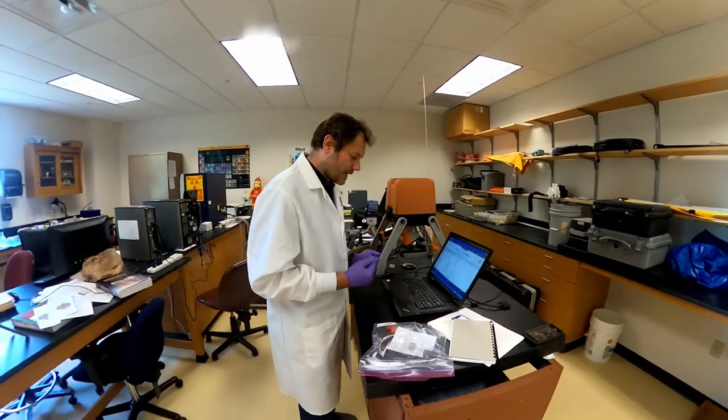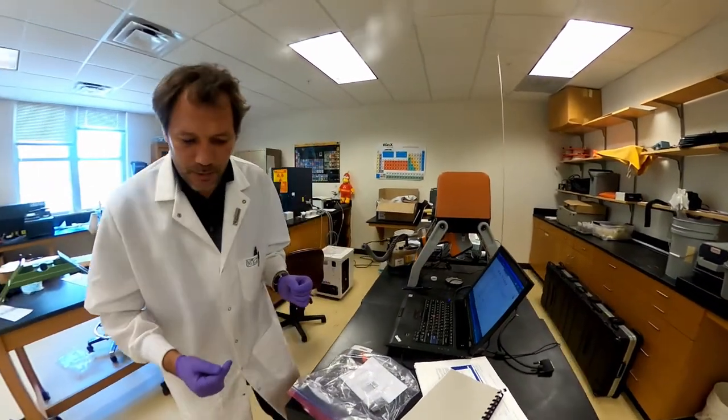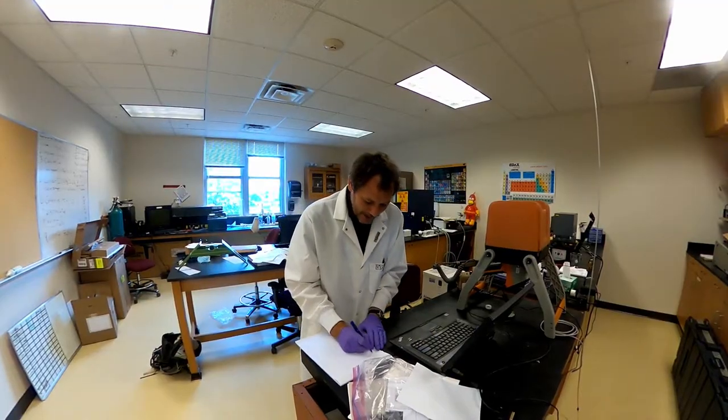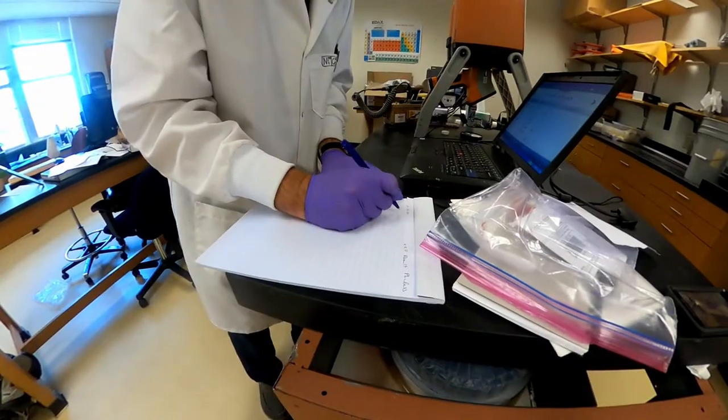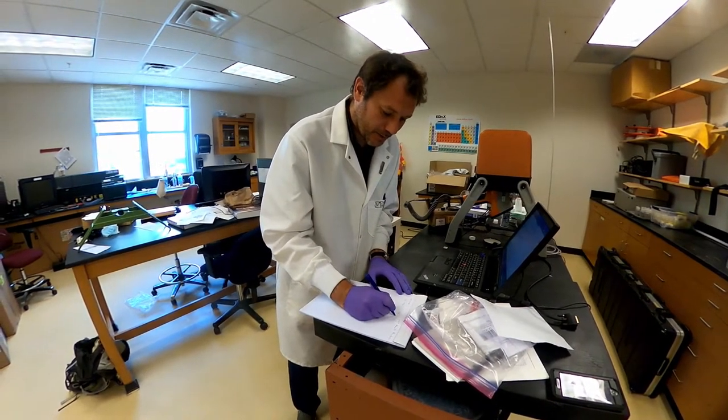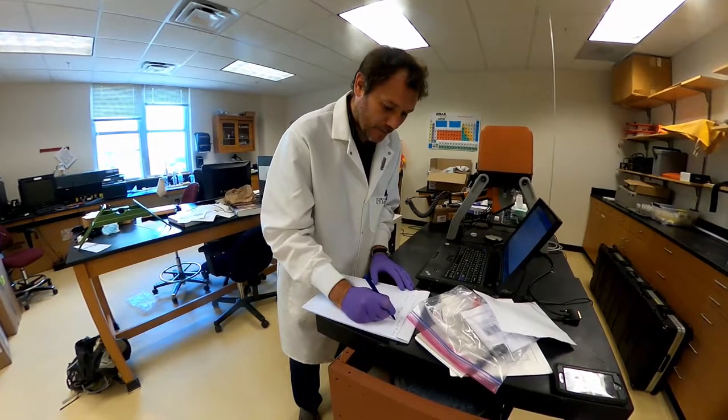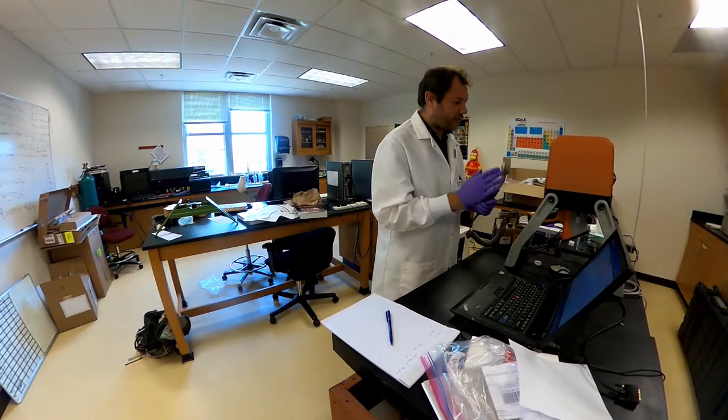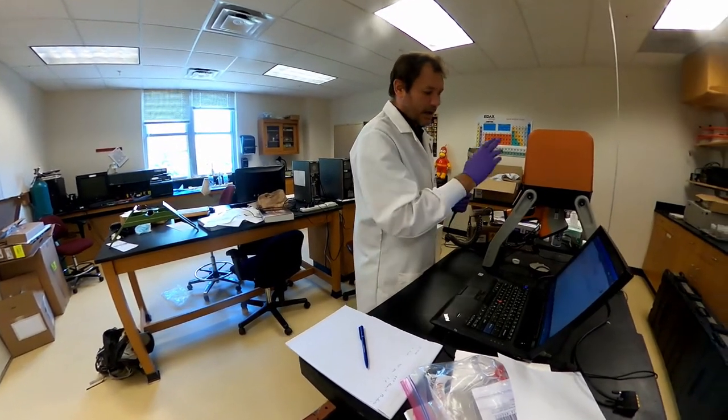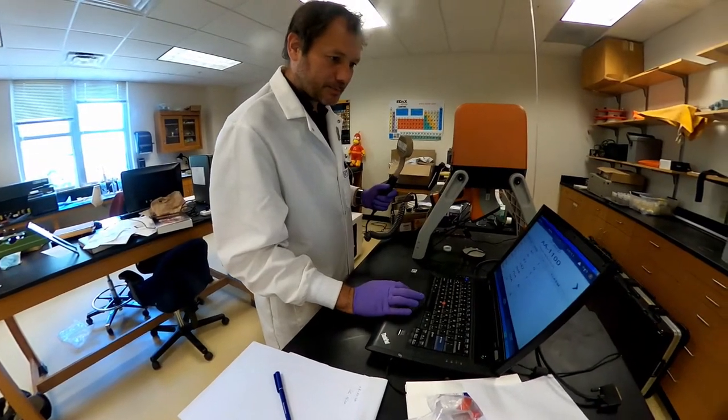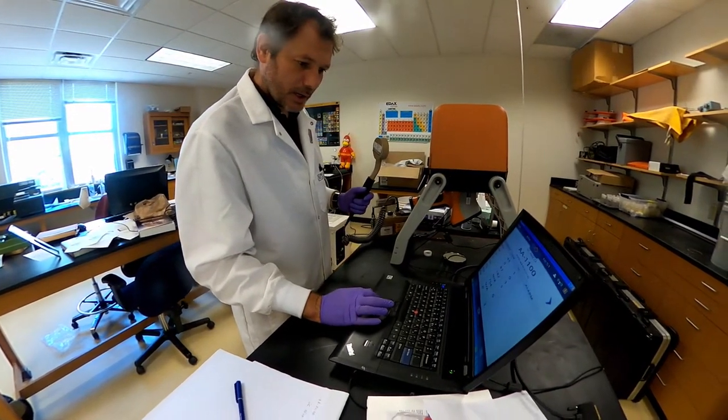So, our value is there. I will actually record the value manually. So, our SC Nico 754 ppm plus or minus 6. Just for a test, I'll just rerun the sample for generating x-ray and we will see if it generates x-ray when we are analyzing.